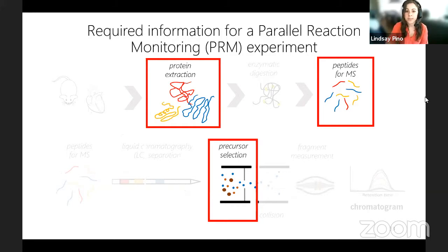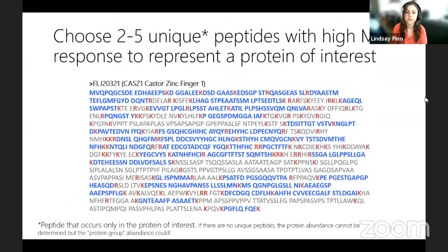The required information for doing a parallel reaction monitoring experiment is nice because there's not a ton that you need to know. You obviously need to know what proteins you're interested in, because you need to decide what peptides you want to measure. And then we decide which precursors, which ion charges of those peptides, are going to be measured. So for example, let's take this zinc finger protein.